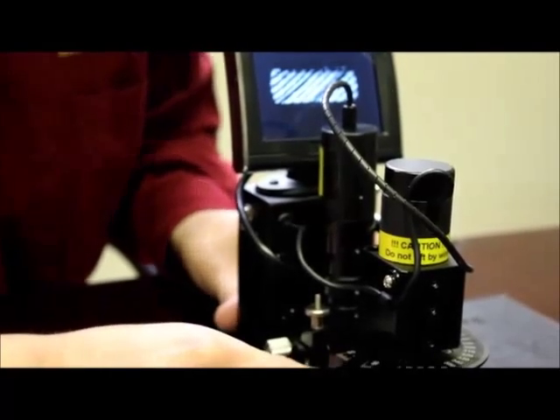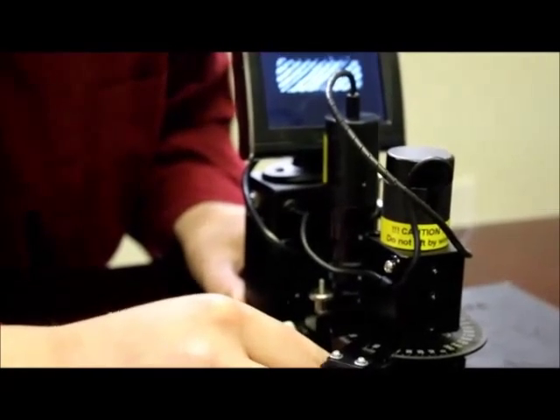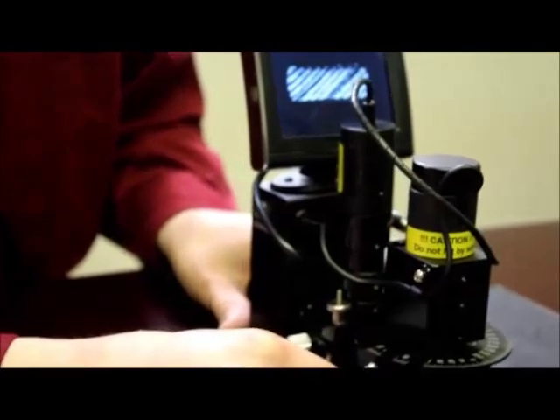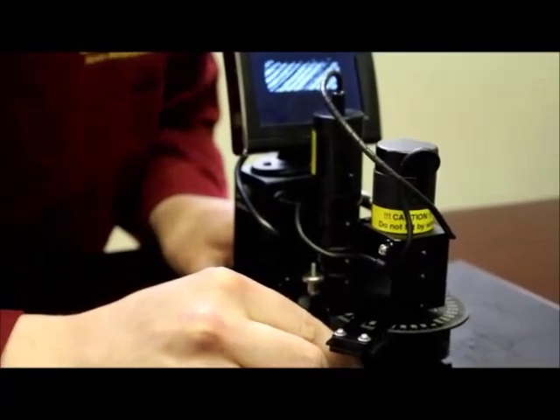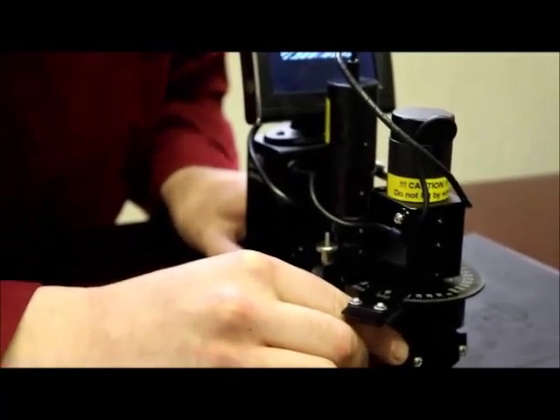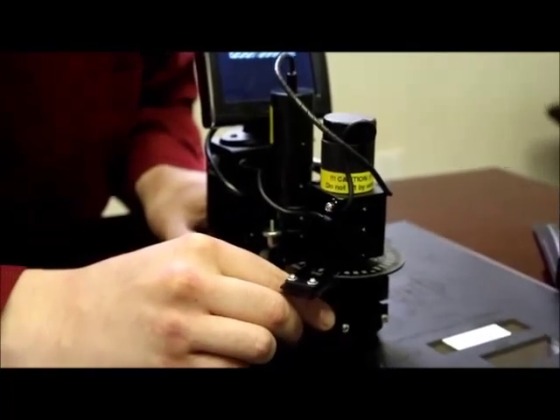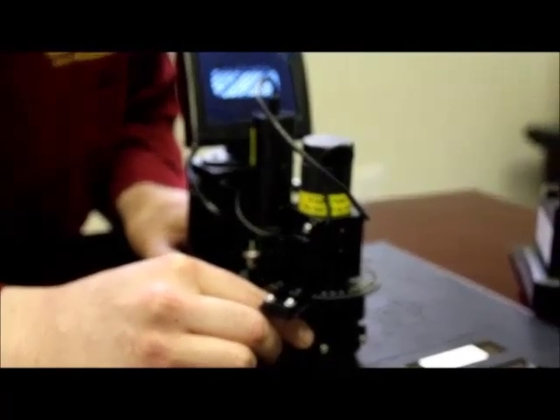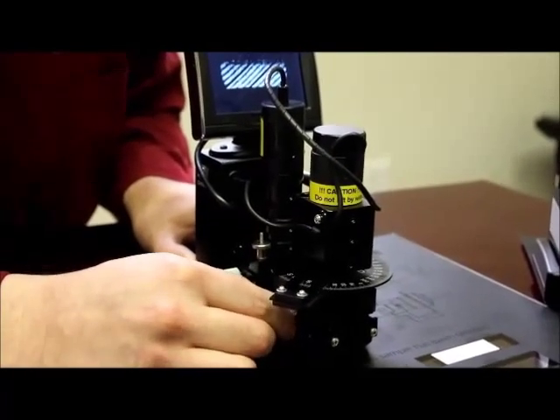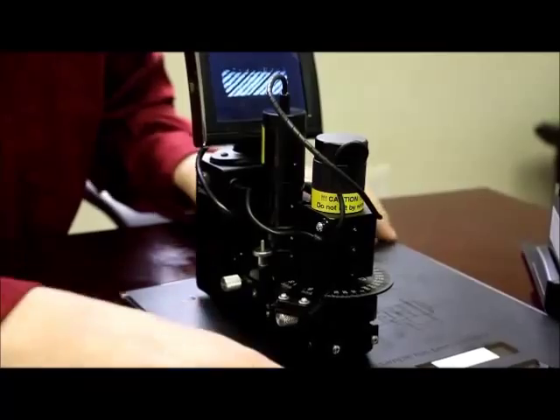The other two adjustments we can make are to the output head or camera head. In a similar way, we will unscrew this thumb screw here and we can move this camera head back or forth. The idea is to move it so that the fringes end up right in the middle of the monitor.